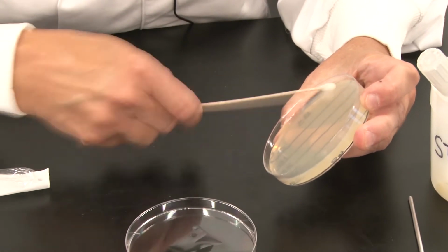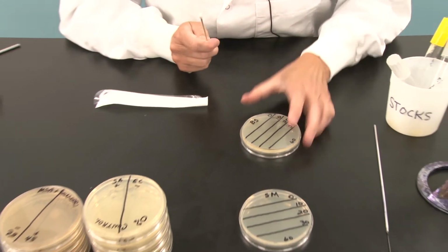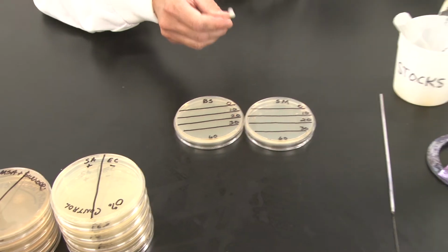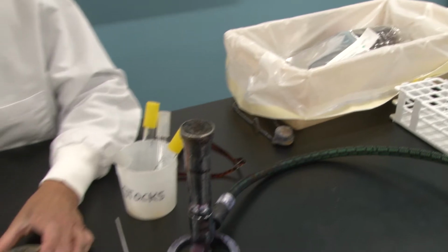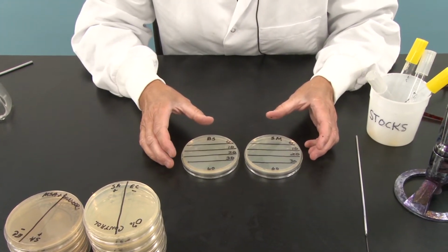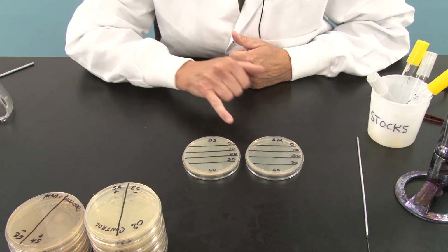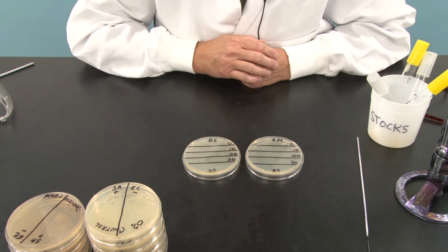Okay, so now we have our 2 lawns of our bacteria that we are going to test against ultraviolet light. I'm going to take my swab and toss it into my disposal bin, okay? Let's meet over at the ultraviolet radiation box in the back of the room, and I'll show you how we are going to ensure that each of these zones has UV light applied to it for the appropriate amount of seconds: 0, 10, 20, 30, and 60 seconds, 1 minute.